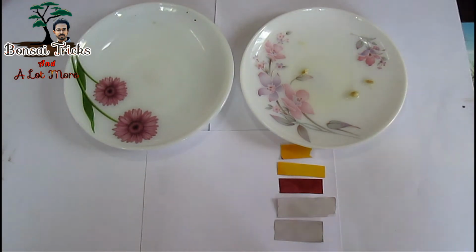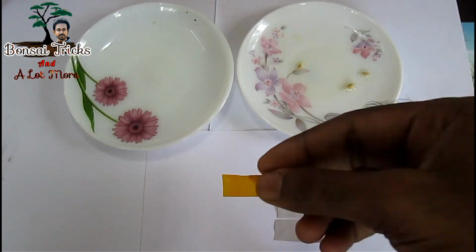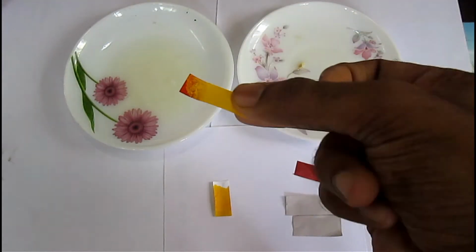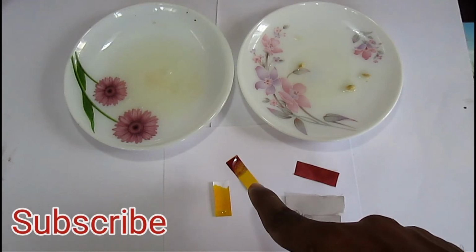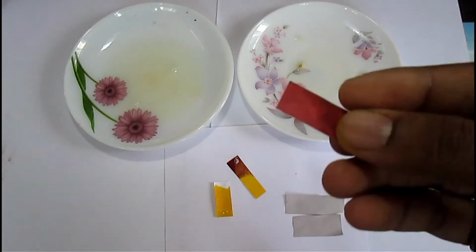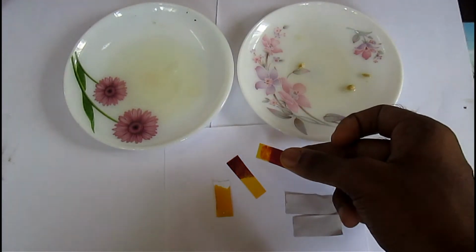Just dip your yellow pH paper or pH strip into basic solution to make it red. I am dipping our yellow piece of paper into acidic solution. The color hasn't changed a bit. Now let's soak the pH strip into basic solution. Friends, can you see that the color is turning into red? That indicates that this solution on the left hand side is basic solution. It is turning into red slowly and nicely, isn't it? Now let's soak our red paper into acidic solution. Friends, can you see that the red color is turning into yellow?